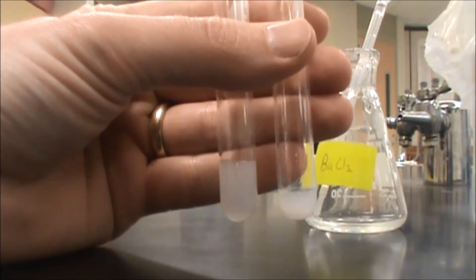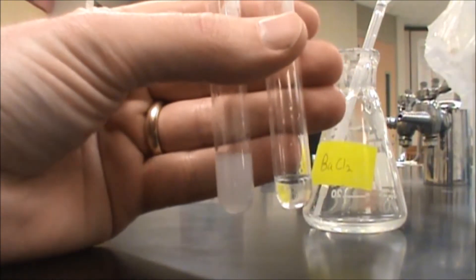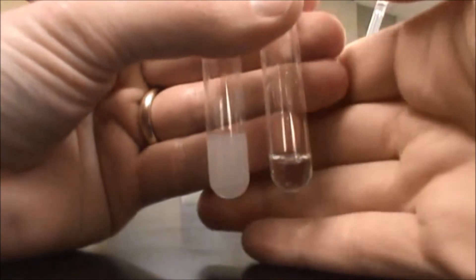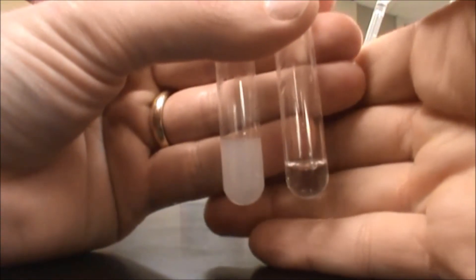But the other one, hopefully, I can get a drop there. There we go. You can see that that precipitate has dissolved in the concentrated hydrochloric acid.